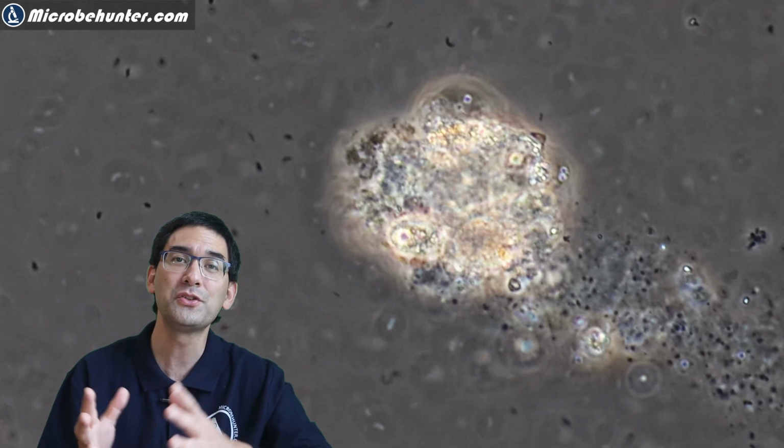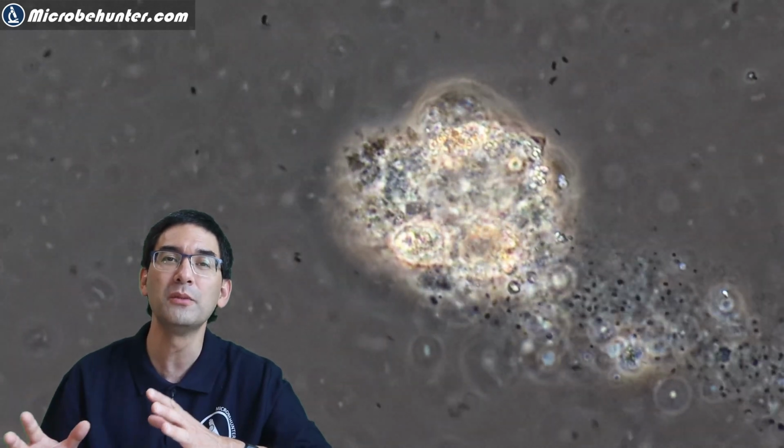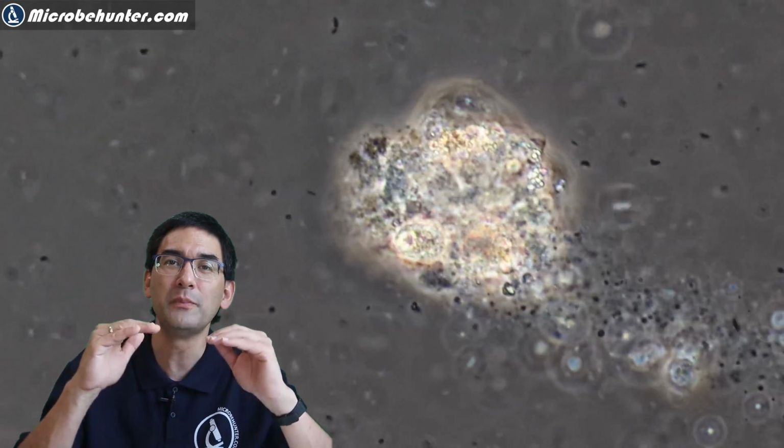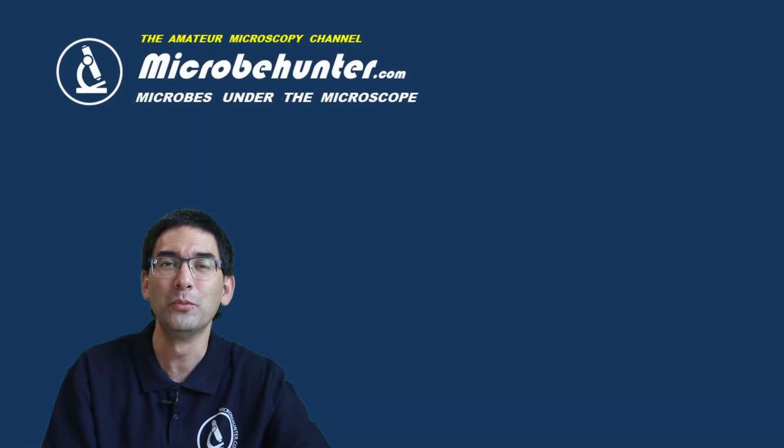Now, if you want to observe water microorganisms, then sometimes this can be a little bit difficult because they move around so quickly. And there is a trick how you can slow them down. One of the ways is to make sure that you do not use too much water so that the cover glass is kind of pressing against the cells a little bit. And this really limits their movement. That's something that I recommend that you try as well.